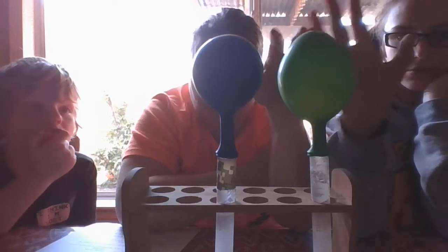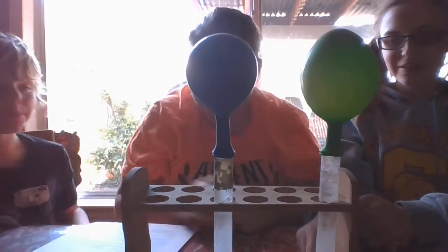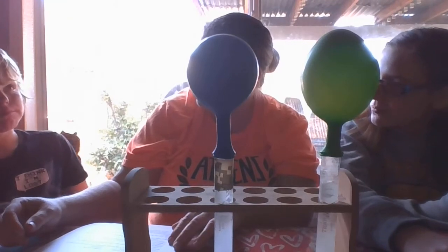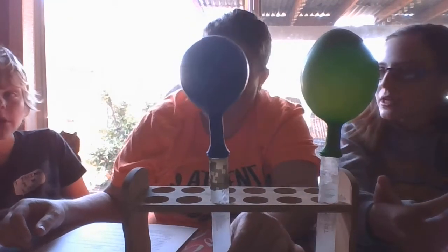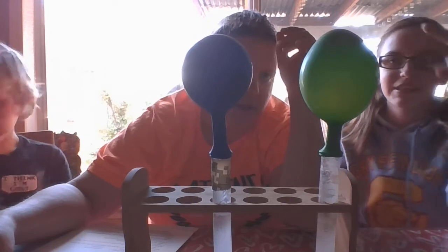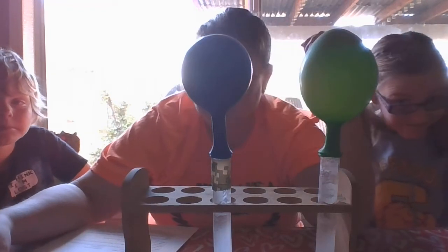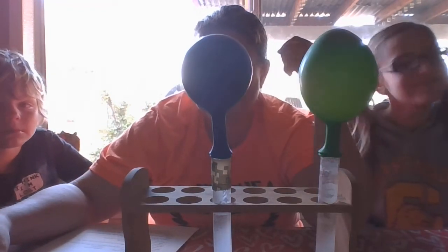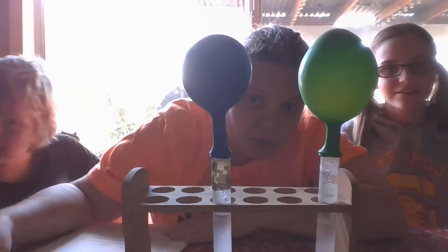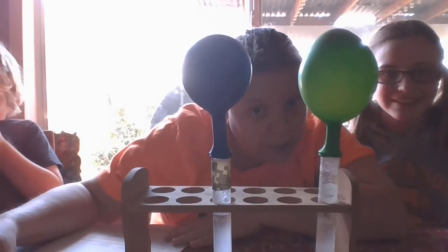It's actually stopping right now. You can touch the test tube — it's actually a very cold test tube. So which reaction had the fastest rate? I would say that was the green one — it happened faster. Why? That's question B. And then C: why are higher concentration reactions faster than low concentration? So answer your questions, pause the video, and go ahead and answer those questions, because we are going to head outside to do something a little messy — elephant toothpaste. We're going to do the catalyst experiment.